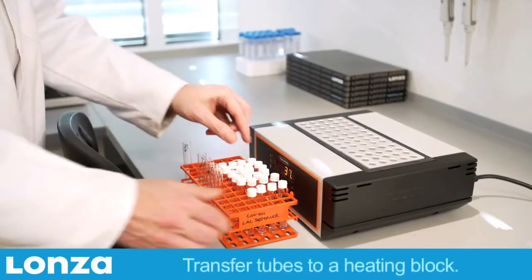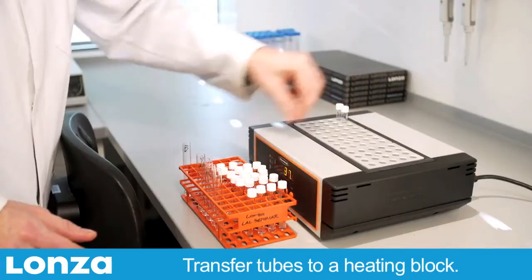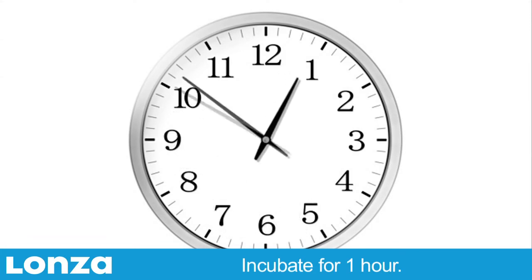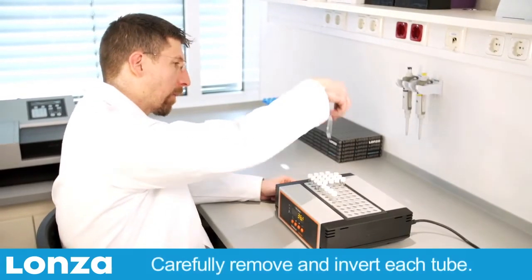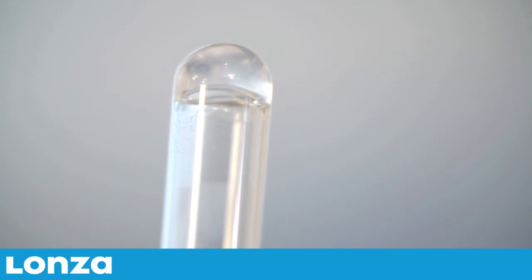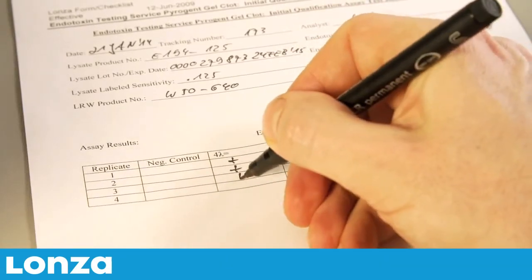Place tubes in a 37 degrees Celsius non-circulating water bath or heating block and incubate for one hour. After 60 minutes, carefully remove each tube and invert 180 degrees. A positive reaction is characterized by the formation of a firm gel that remains intact when the tube is inverted. Record the reaction in each tube as either positive or negative.